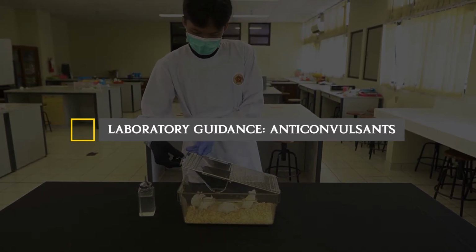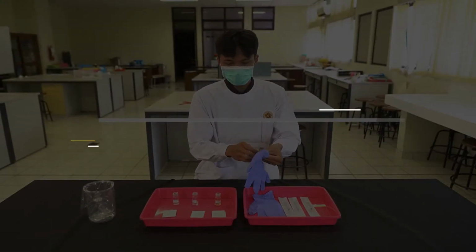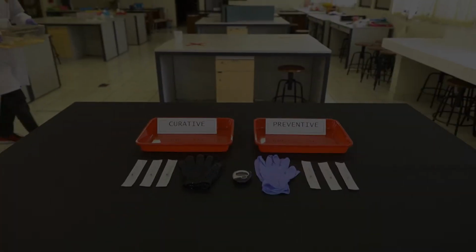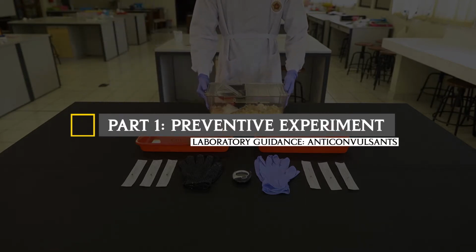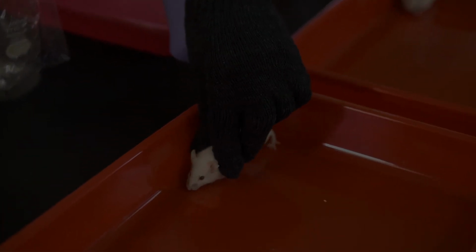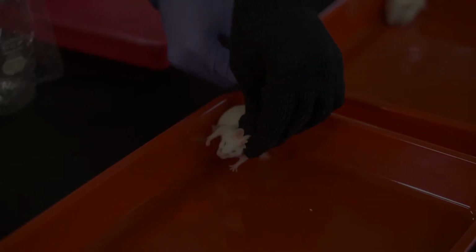Today, we will discuss drugs acting as anticonvulsants and their preventive and curative effects. The video is divided into two parts. In video part 1, we will learn how to calculate the dose for mice and how to conduct the preventive experiment. In video part 2, we will learn how to conduct the curative experiment.